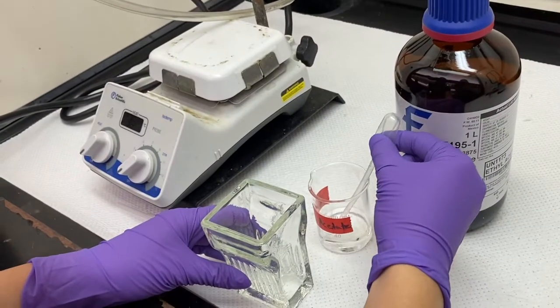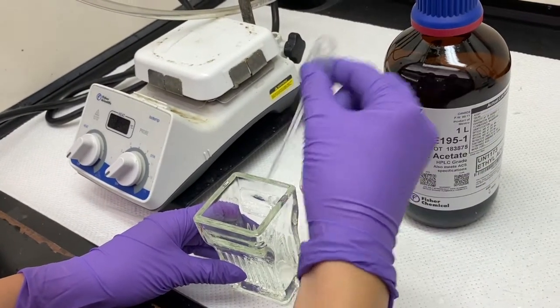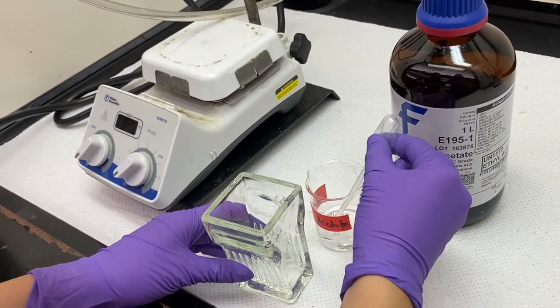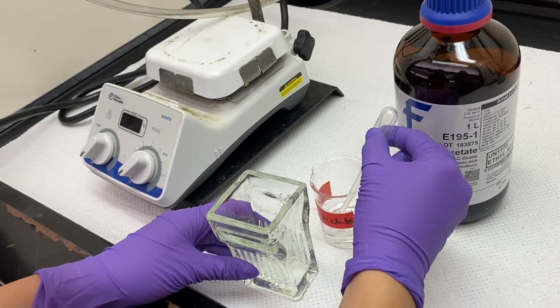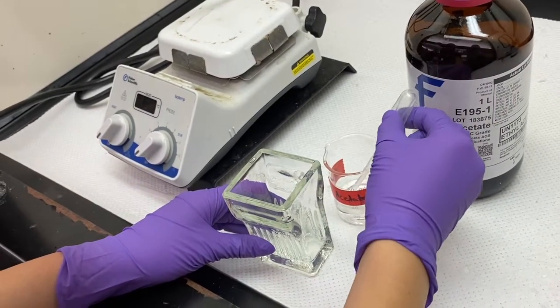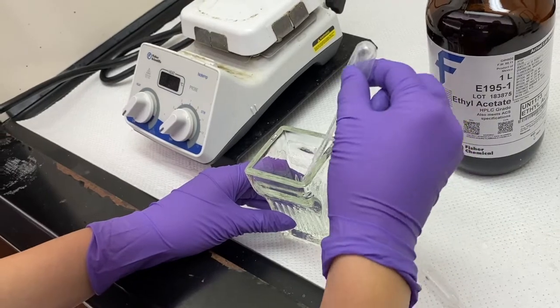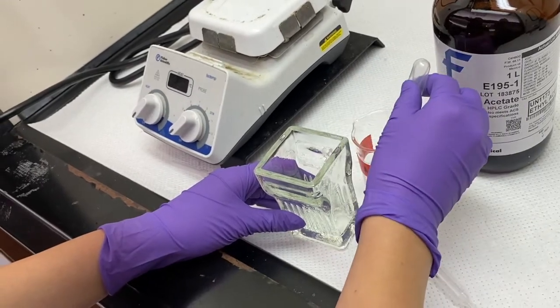To prepare the chamber, add three milliliters of ethyl acetate to the bottom of the chamber. The ethyl acetate is the mobile phase, which will ascend up the TLC plate throughout the experiment.